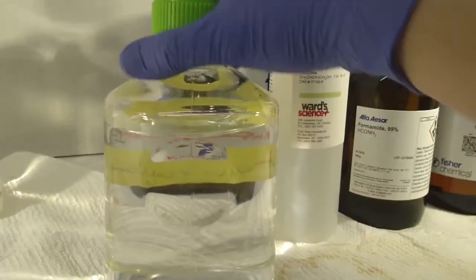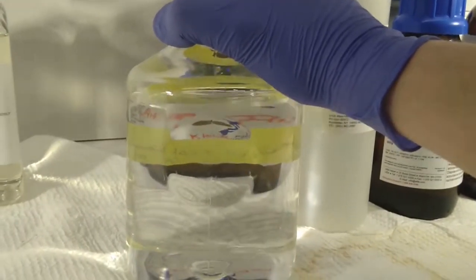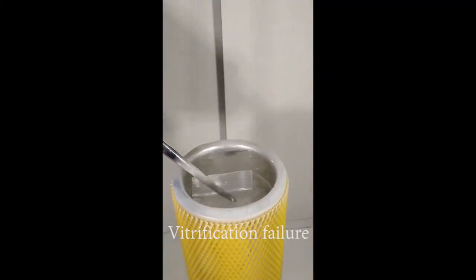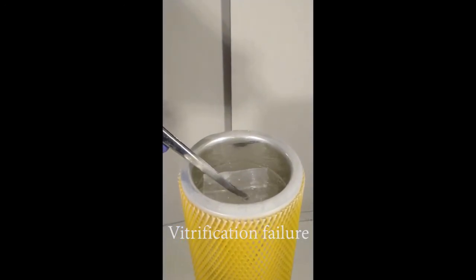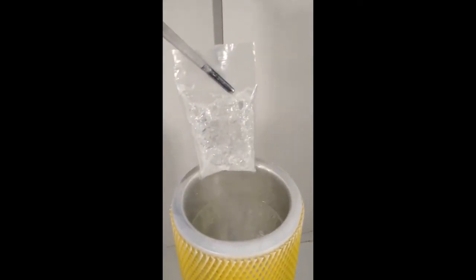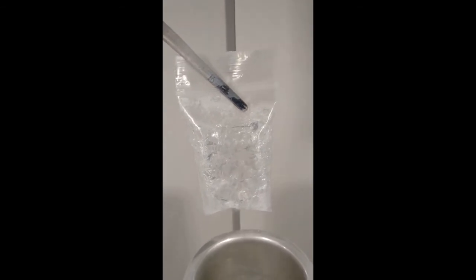So in this state, it's very stable, and we're going to show you some videos. So if the CPA was cooled incorrectly, say it was dunked into liquid nitrogen, the CPA upon cooling can actually crack, as if it were a glass.